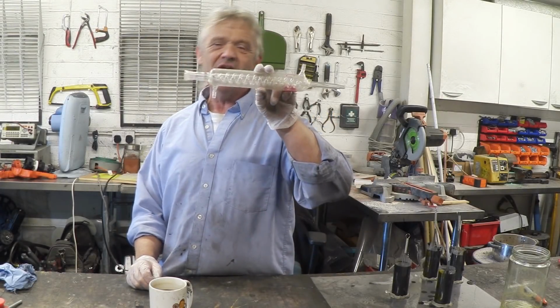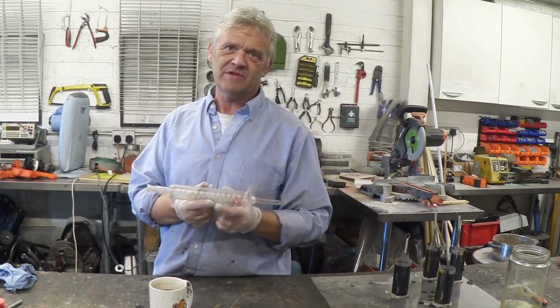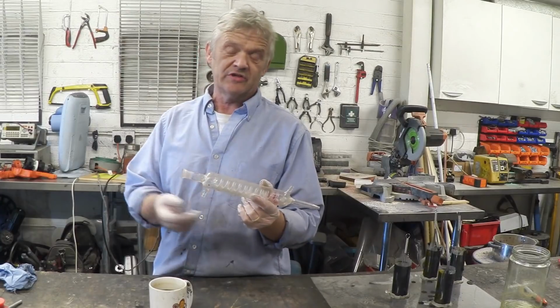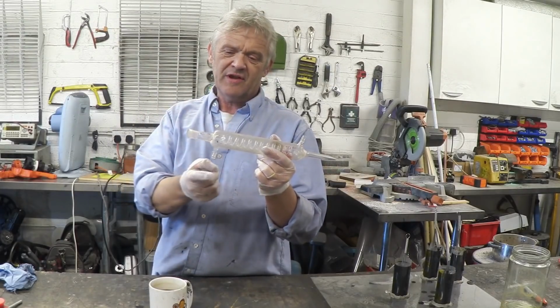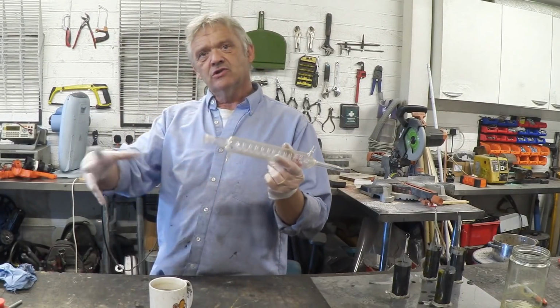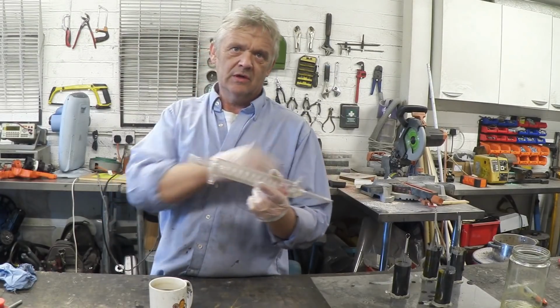Okay, so we are in fact chemists, and being chemists means we have access to some equipment like this, which is a really awesome piece of chemical equipment. This particular bit was given to us by our friend Graham. It's a distillation tube, a water distillation tube. Here and here, it has this glass spiral going through an outer envelope, and we can attach water to one of these, turn it on, and it flows through and flows out the other side. So whatever we're attempting to distill will go through here, get cooled, and drop down.